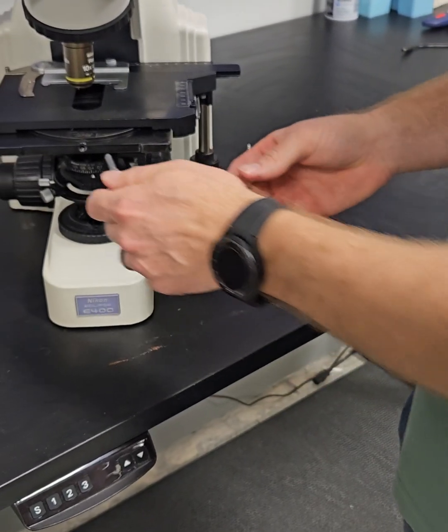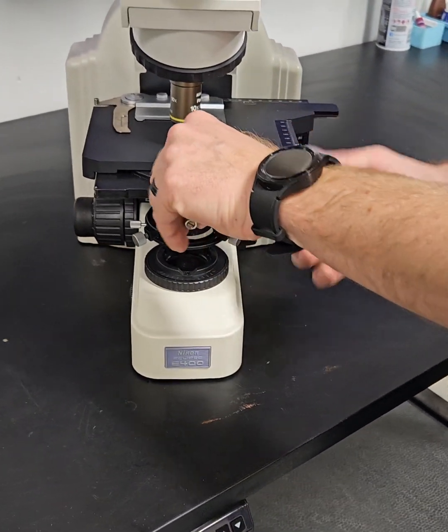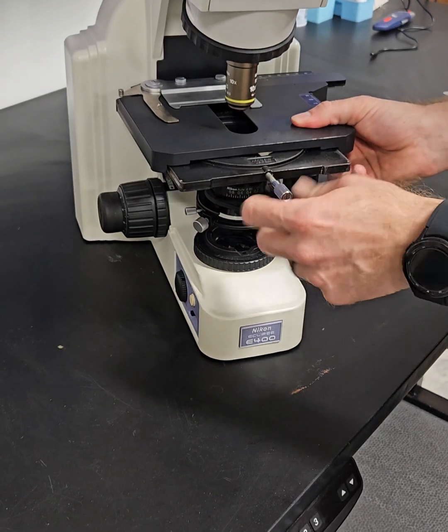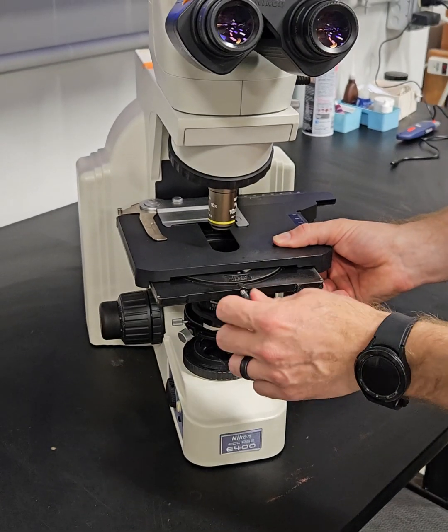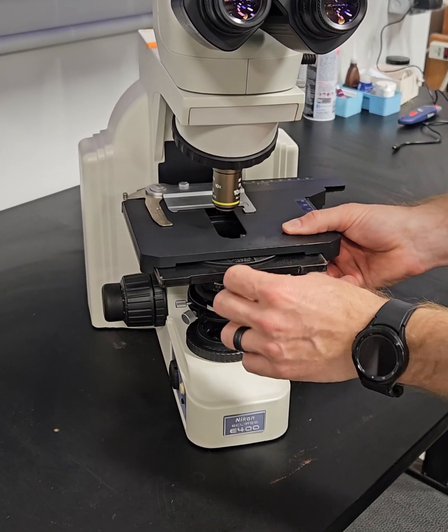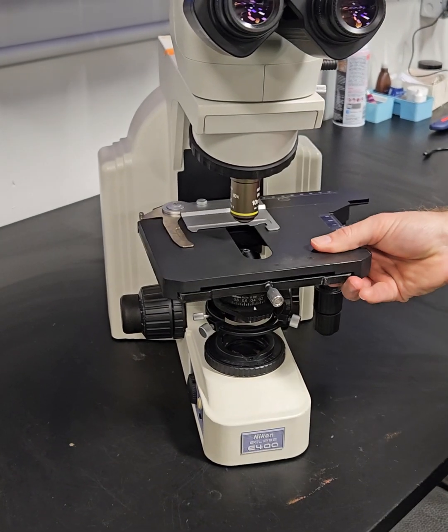So over time, whenever you go to lock your stage down, the stage, let's put the screw in. The thread on these things are really long. So you'll lock it down and half of that plastic will be there and half will be missing. So it won't get a good grip. And then your stage wobbles like this, okay?